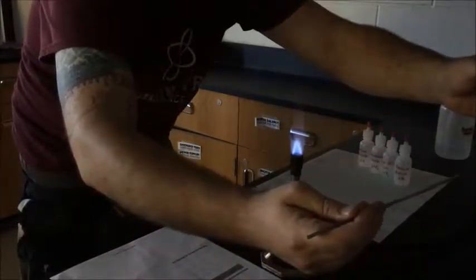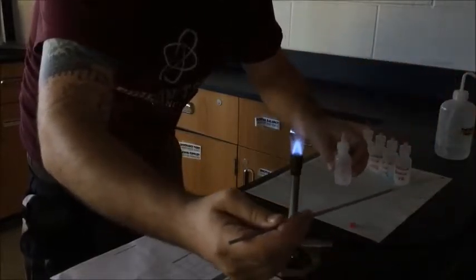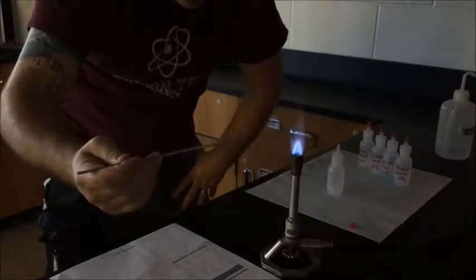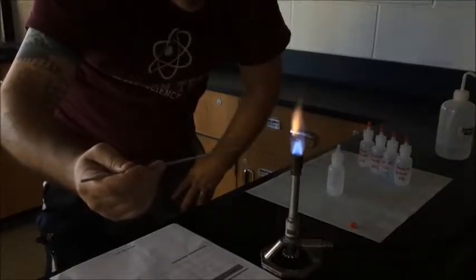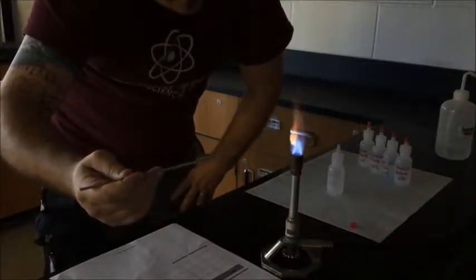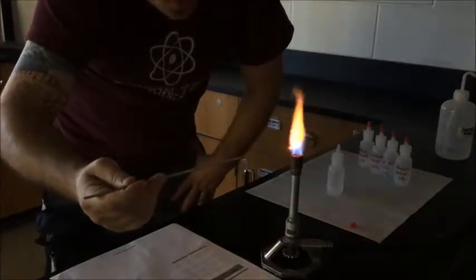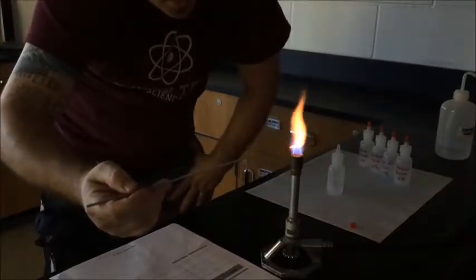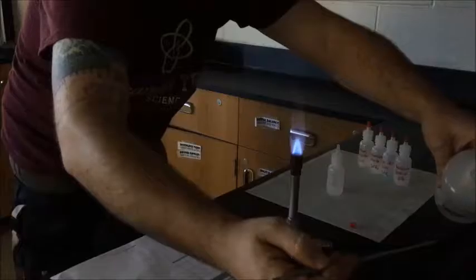Maybe you didn't see it and you've got to see it again. Get a drop of the liquid on there. It's a bigger drop. Hopefully, it'll show us a better result. Kind of heat it in the flame there in the edges. Get down into the hot part of the flame and you see that dancing colors start to show up. For me, this particular example looks a bit like a light yellow green almost. Yeah, there it goes. Now, as you can see, if I hold the loop in there too long, it's not showing me that dancing color anymore. It's just kind of turned orange. So, one more time to show you. Rinse between samples, even if you're doing the same one twice.